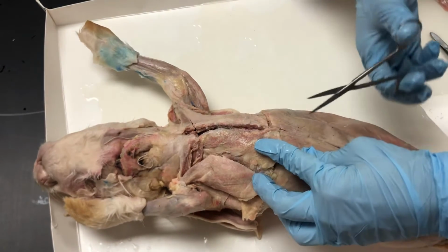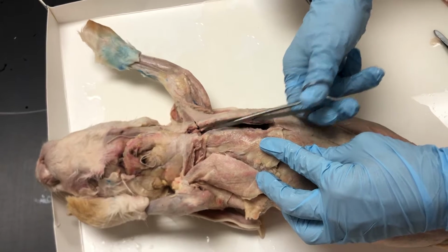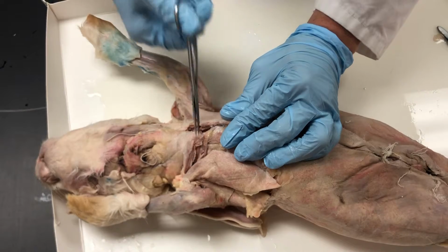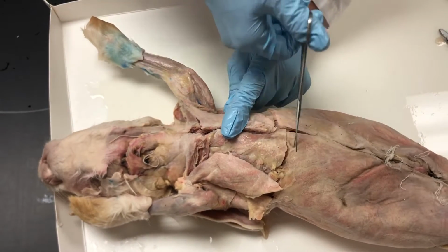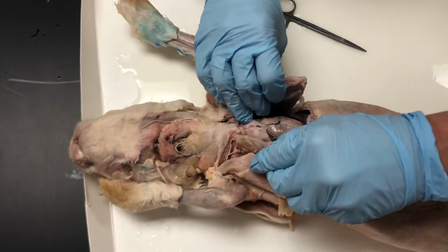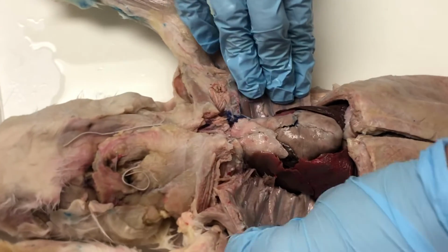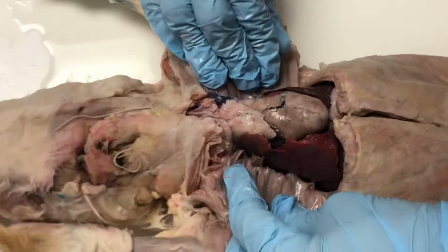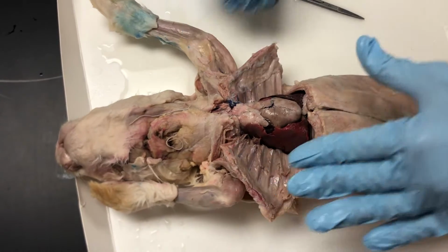I began at the inferior end, and we cut up along the rib cage to one side of the sternum. You're also going to make lateral cuts up at the superior side in both directions, and then also at the inferior end of the thoracic cavity, make lateral cuts as well. Now at this point, you should be able to pull apart the rib cage to get inside. When you open this, you're going to probably be cracking some ribs and hearing some breaking. That's okay. This rabbit's already dead. But you're going to really want to pull away that rib cage so that you can get in and see the organs of the thoracic cavity.